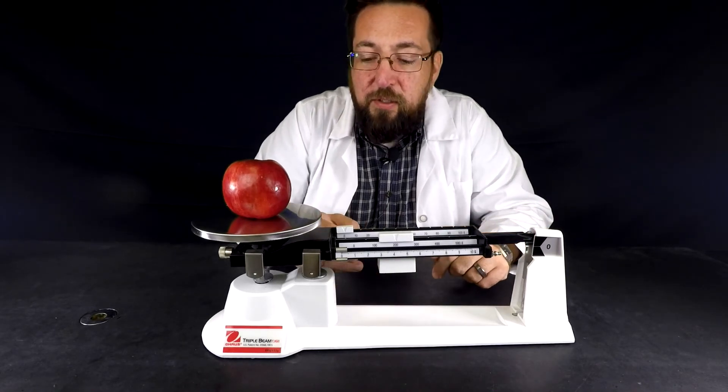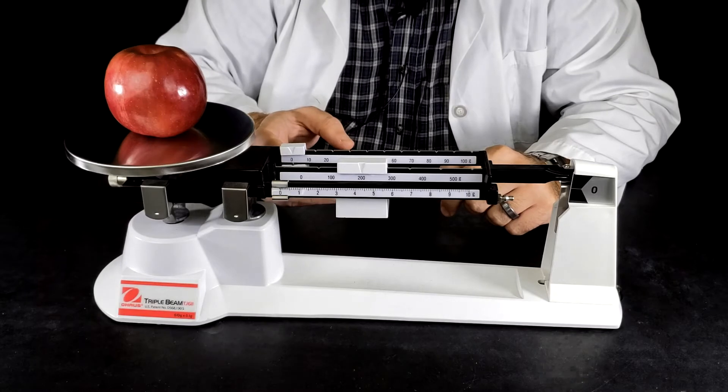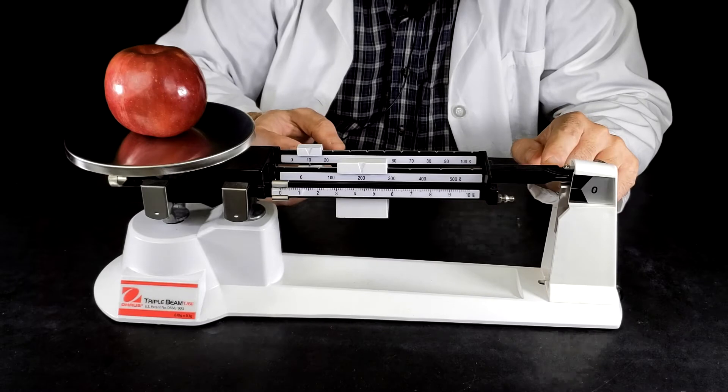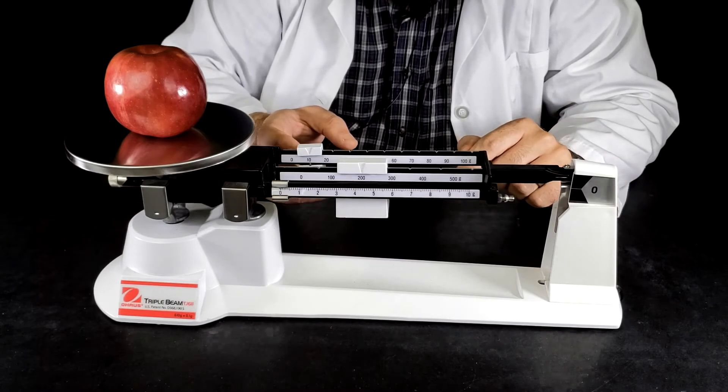So is it 210? Greater than 210 but I saw this move a little bit so I'm going to move it 10 more.